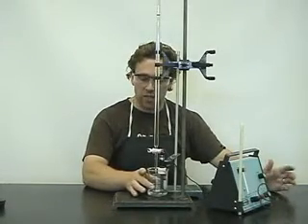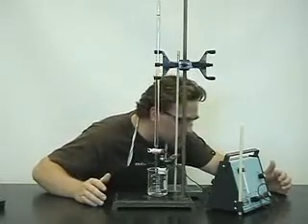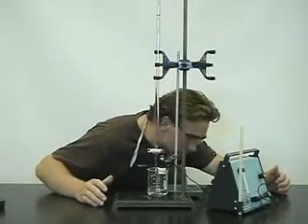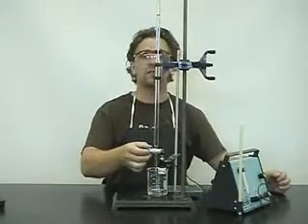We'll notice the pH is 1.18. Let's just stir and make sure that it's mixed, and do the reading again. 1.18. What we do is we add another five mils.